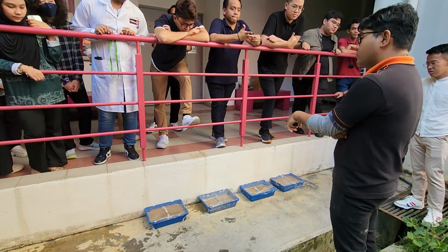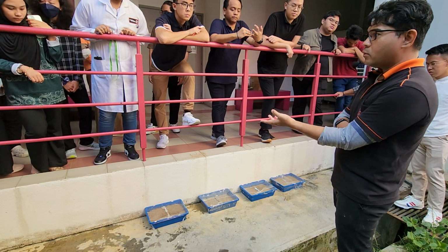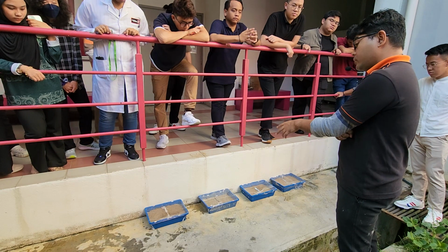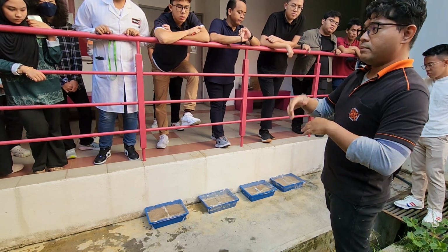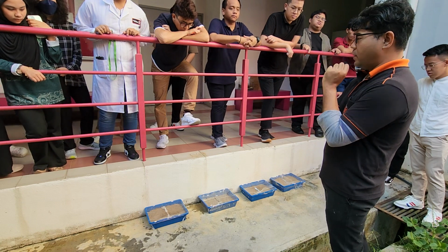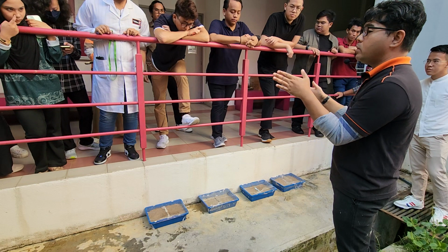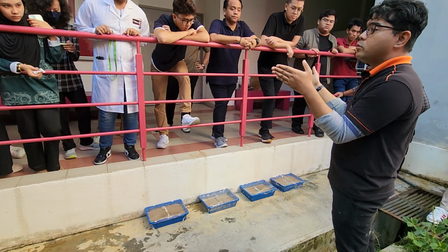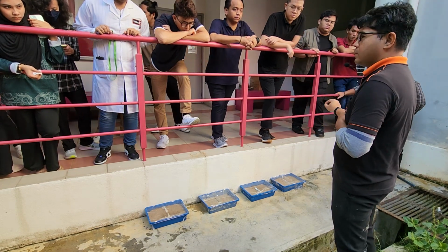And you're going to leave this for 2 or 3 weeks. So that's why on Wednesday, we're going to be putting some fertilizer to it, which also coincides with your small lesson about nutrition on Monday and Wednesday. So be on time on Wednesday. We'll learn a bit about plant nutrition, and then you use your fertilizer to fertilize this.